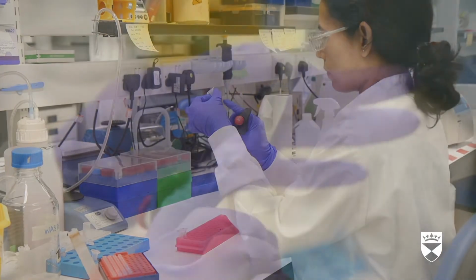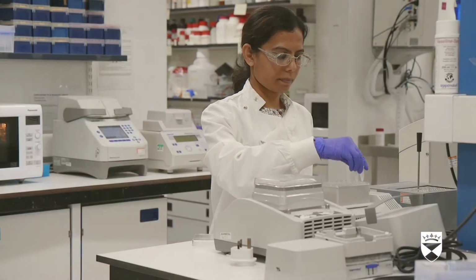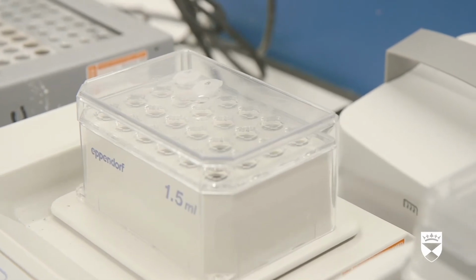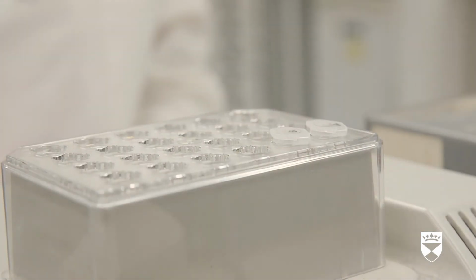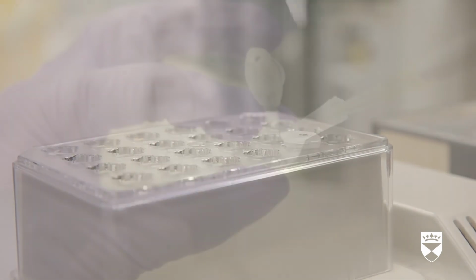Next, we add an enzyme to chop the proteins up to make them smaller. Then we put it in a thermal mixer. This machine heats and mixes the contents. We call what we will study in the mass spec the sample. The scientist then adds the sample into a pipette tip with a white filter inside that is held in each of the tubes and returns them to the centrifuge. She examines a tube, where the liquid has gathered at the bottom of the tube. The sample is not quite ready to go into the mass spec yet.